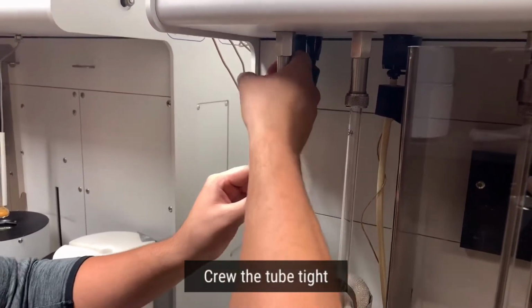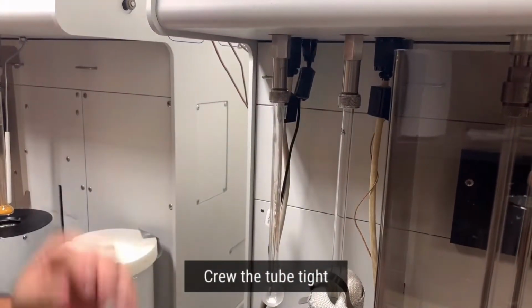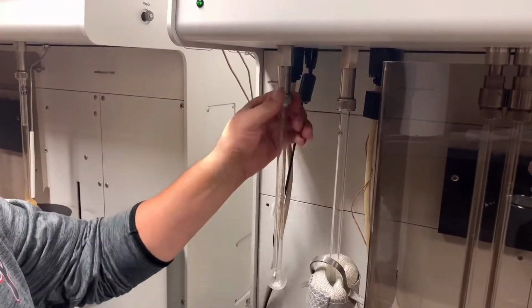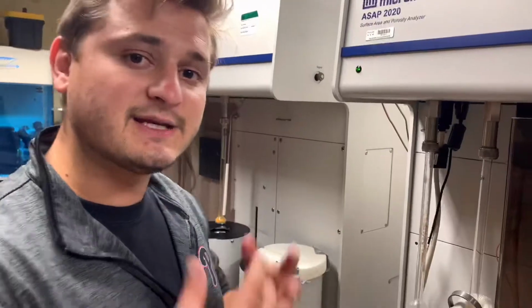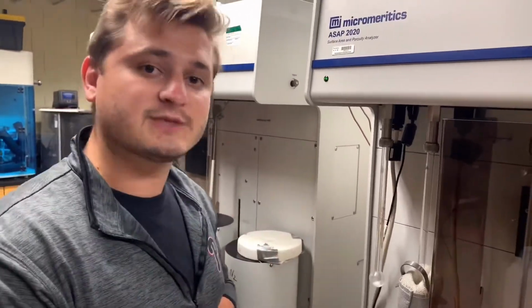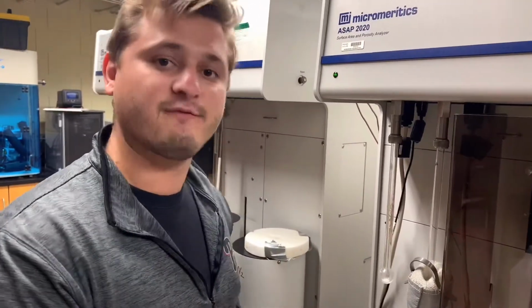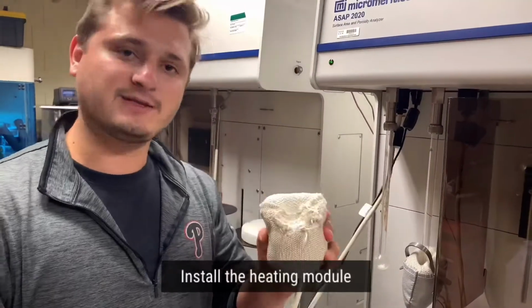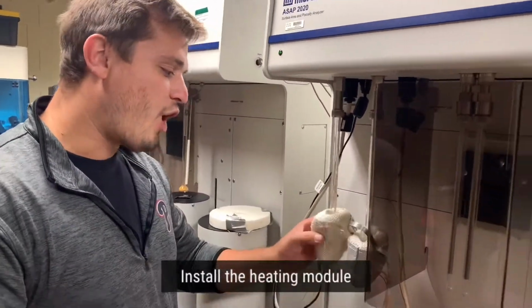and then screw on the sample tube connection. You want to make sure it is tight. You do not need to use a wrench or anything of that nature. You just want to make sure it's hand tight. But making sure it is tight is very important so that there are no leaks within the analysis or the activation of your sample. Finally, we want to take the heating mantle and secure it safely onto our sample tube.